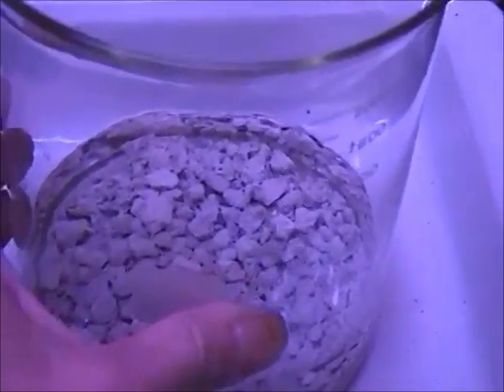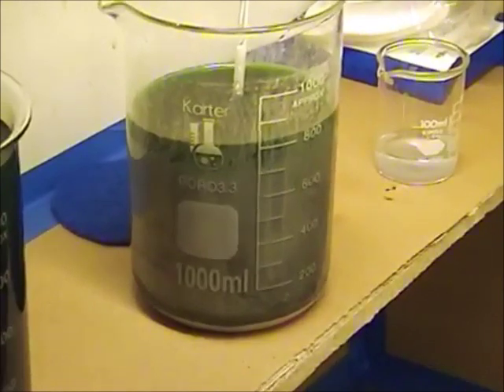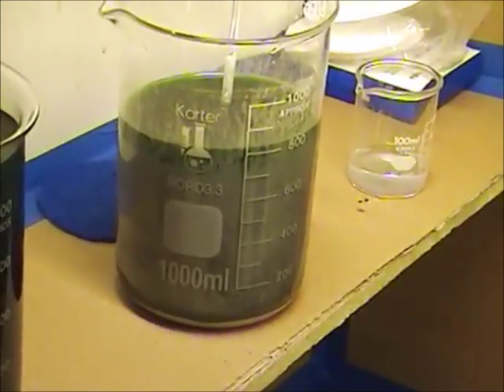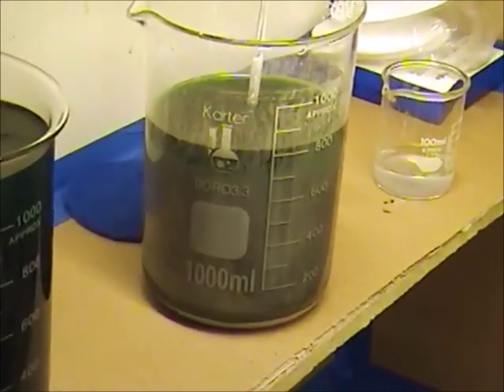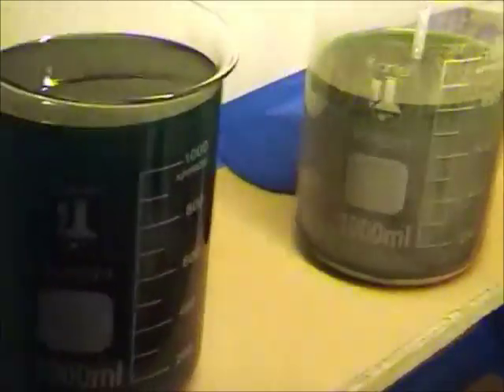What I've done is I wanted to get the first drop from the solution and send it off for testing, but I also wanted to get the second drop from this solution and send it off for a test as well. During the cementation process where we use copper to remove silver from a silver nitrate solution, the first crystals that precipitate are usually the purest. Those that come later drag down copper oxides and copper from our solution that makes them trashier.